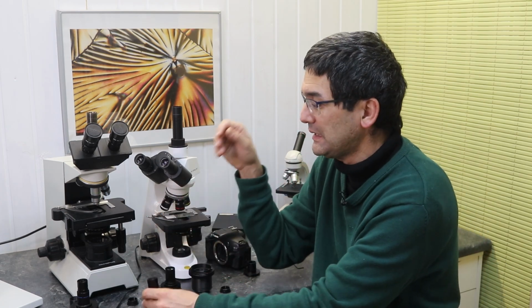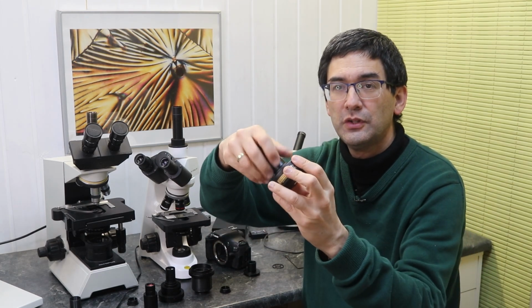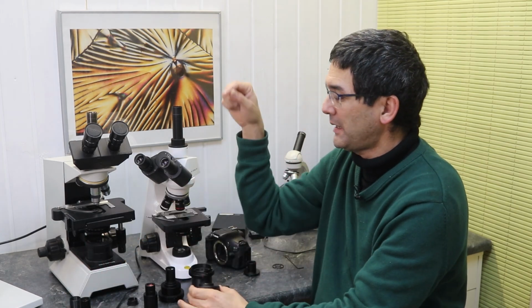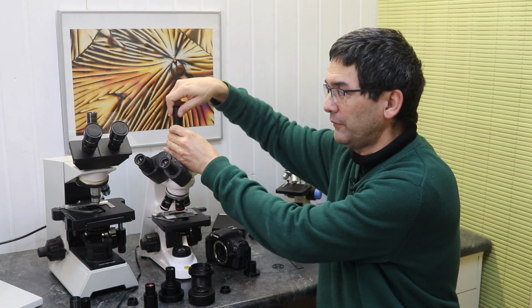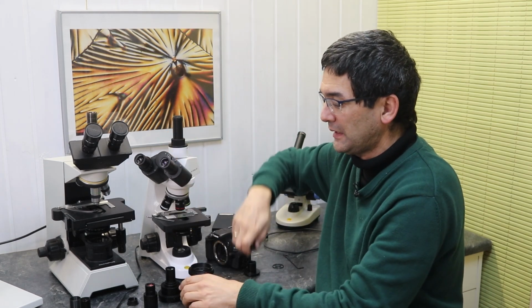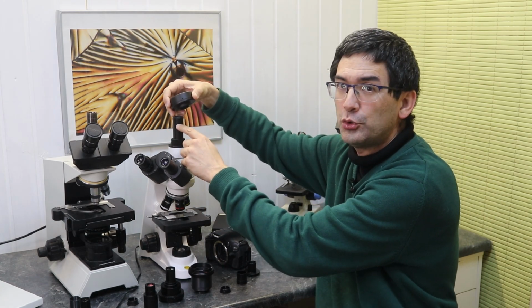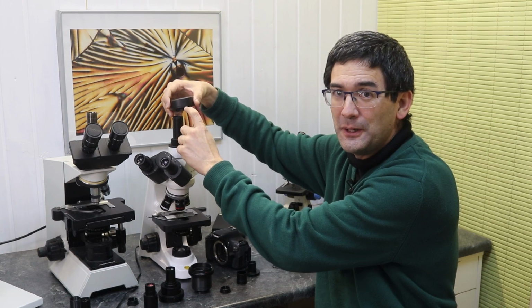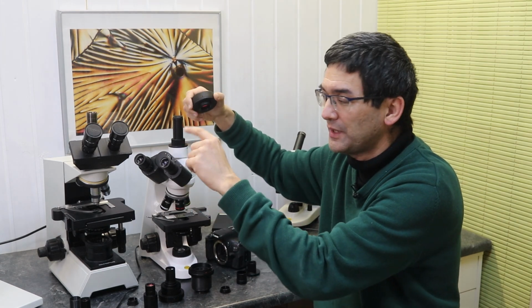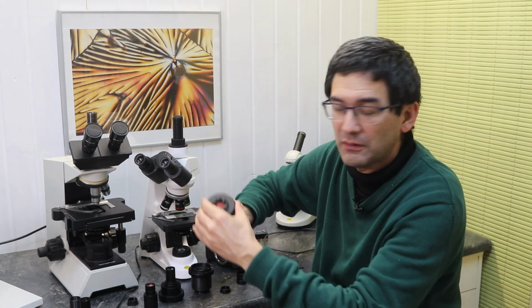A second possibility is the following. You might not know that, but it is possible to disconnect the reduction optics. Then what you have over here is a so-called C mount, and by removing this top part of the phototube, again, not all phototubes allow you to do that, I'm able to directly connect the camera to the phototube, and then I'm also able to project the image directly onto the sensor. And that's why the distance is important, because I want to make sure that when it's in focus through the eyepieces, it should also be in focus on the camera. So that is essentially the theory behind it.